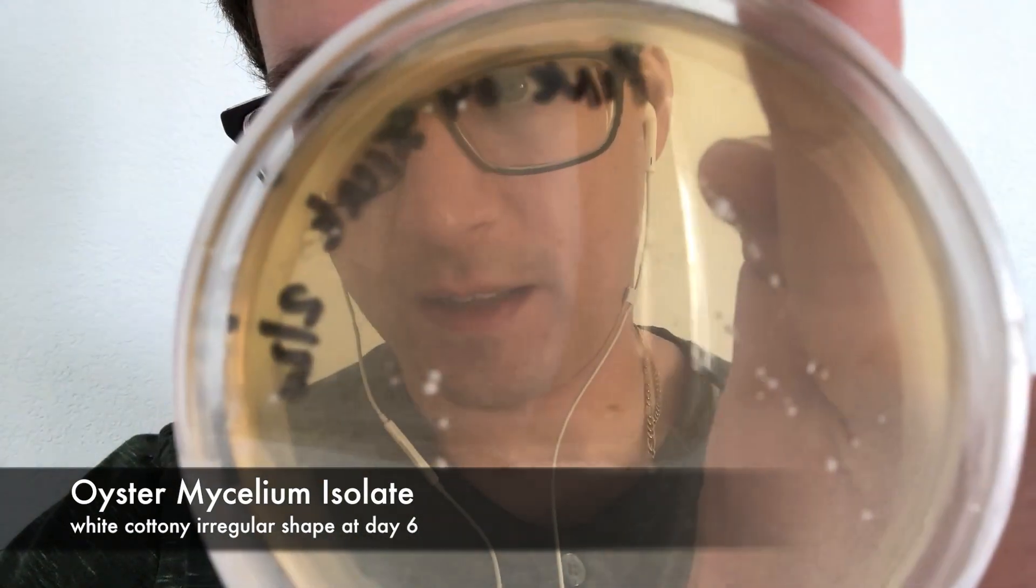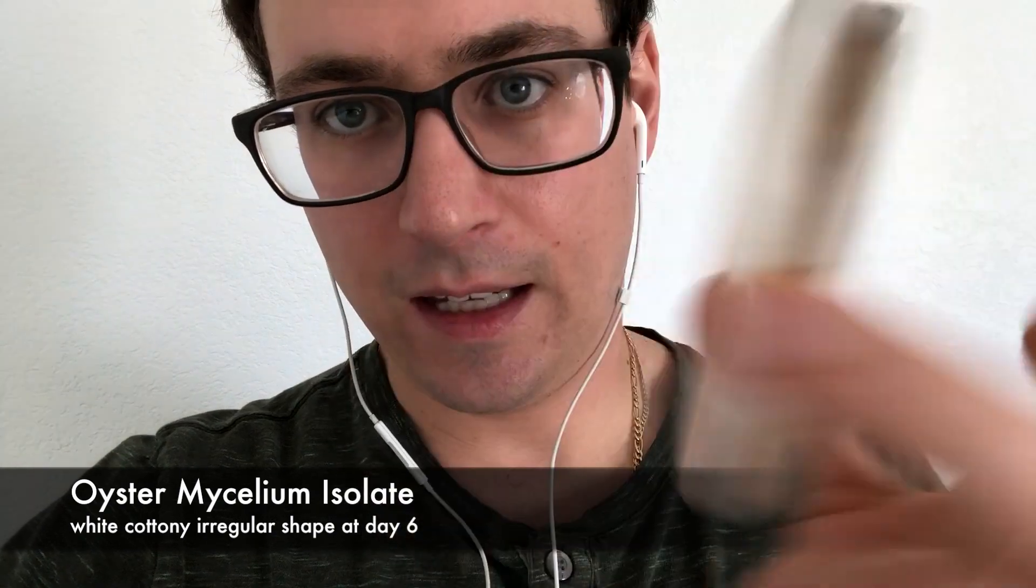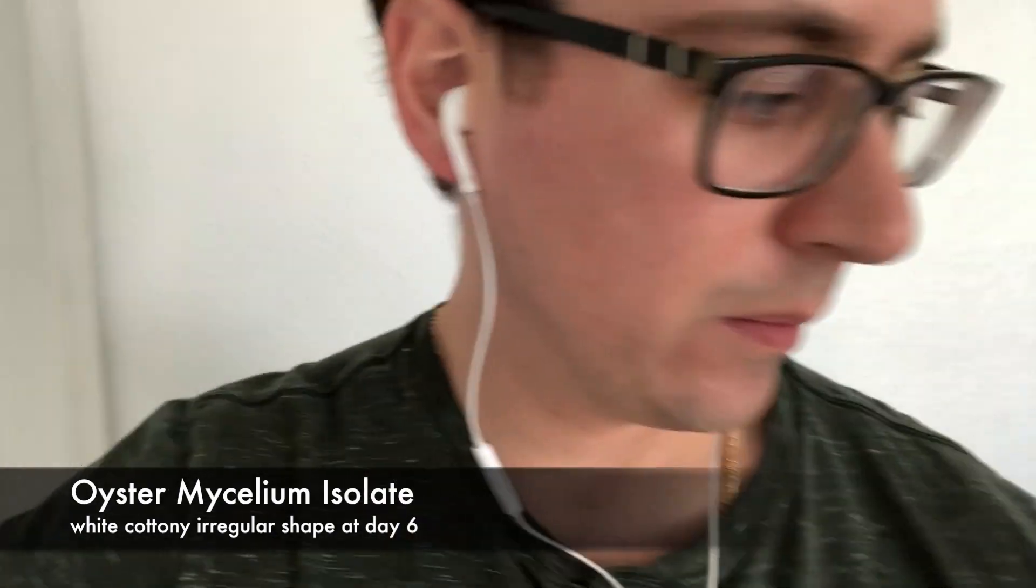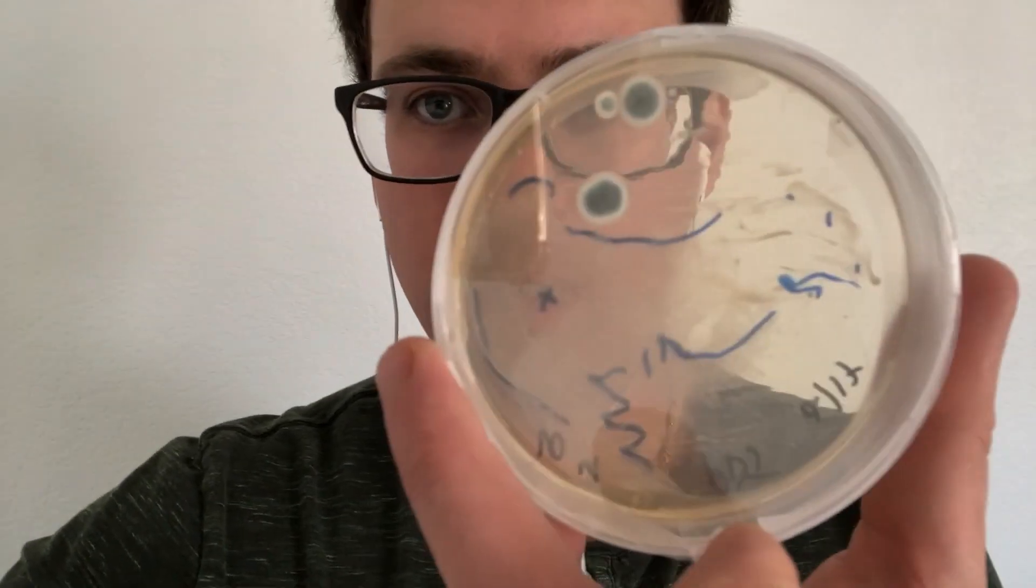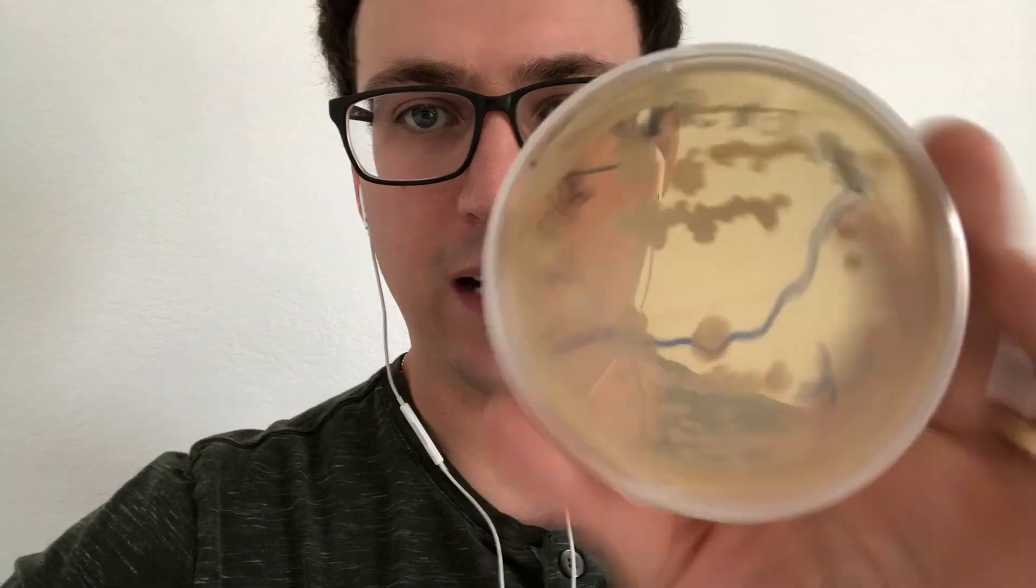So that's what you want to look for, it's kind of an irregular shape. This one's almost in the shape of a heart and that is how you're going to differentiate between that colony and younger penicillium. But if you just wait a couple days, the penicillium will start to turn green in the middle and you do not want to open this.